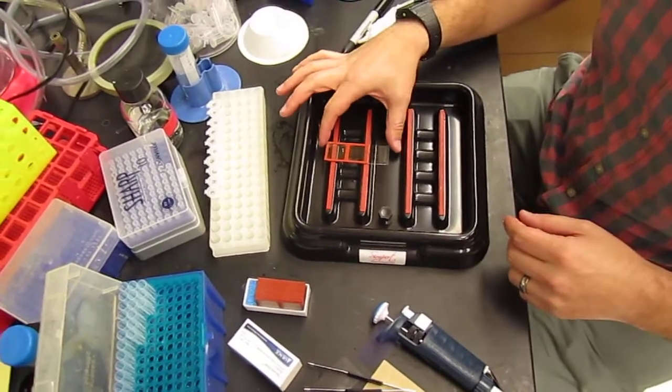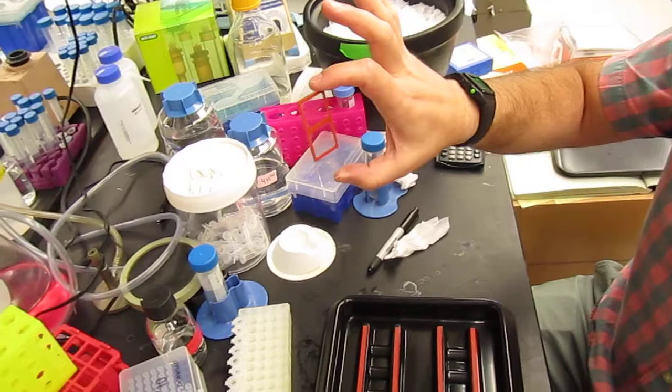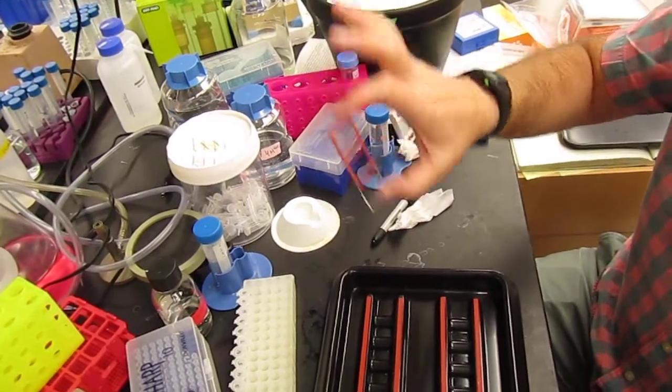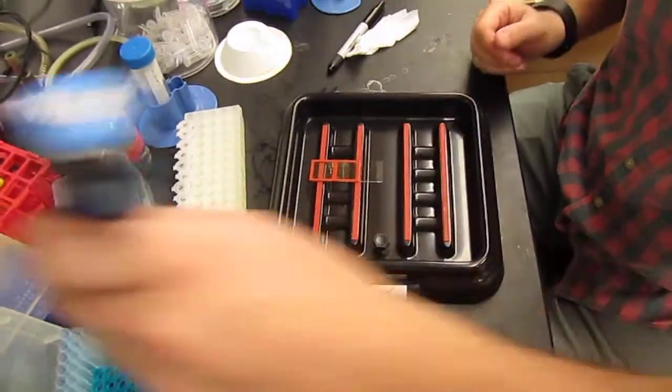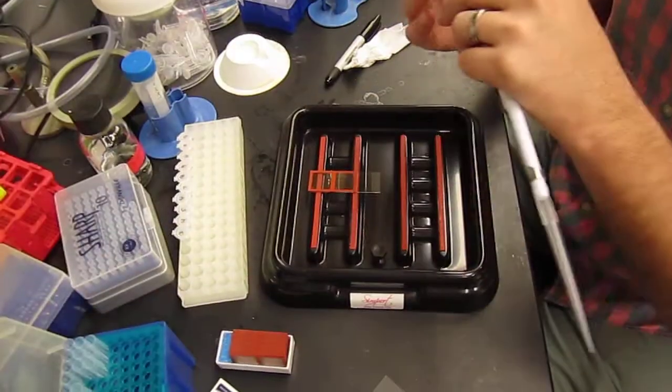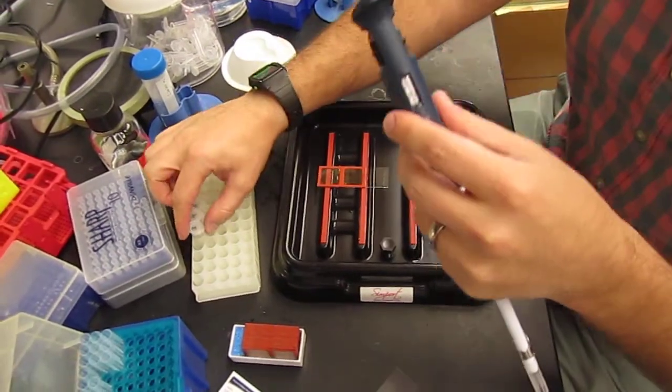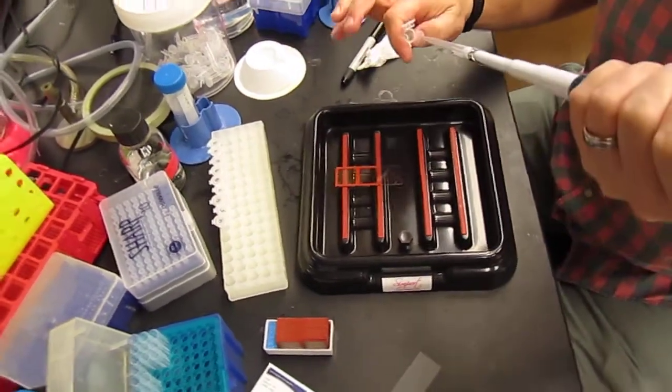There are two ports on each of the subarrays. The two ports need to remain open while pipetting volume. You'll pipet 350 microliters of volume.